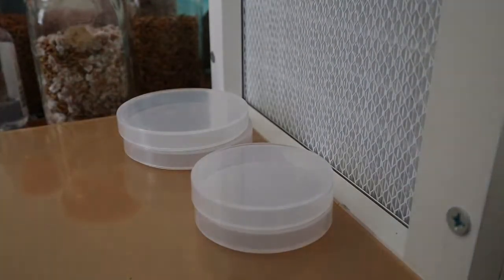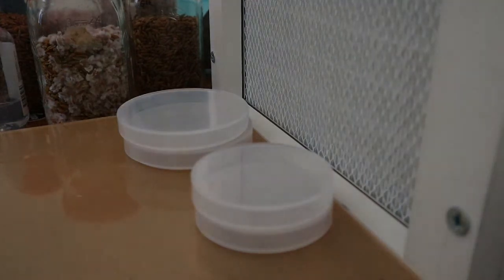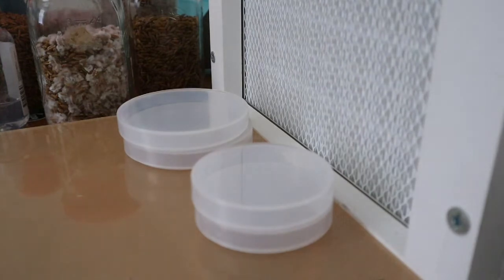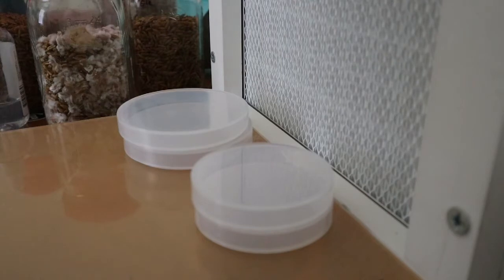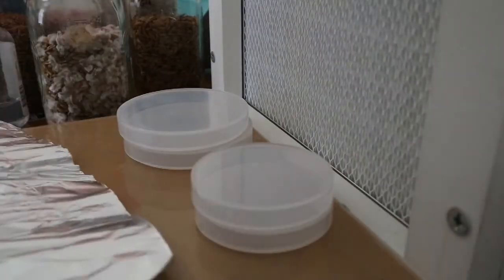Now, we don't need to be working in front of the flow hood, I'm just here because it provides a good angle for the video. Alright, so the next step, let me grab my tin foil, aluminum, heavy duty preferred. If you don't have heavy duty, that's fine. Alright, so you guys can see I got a nice big chunk.